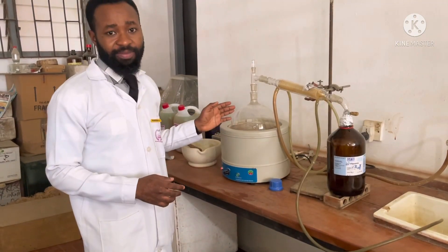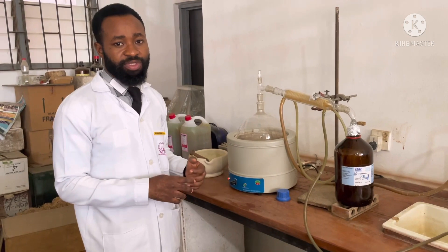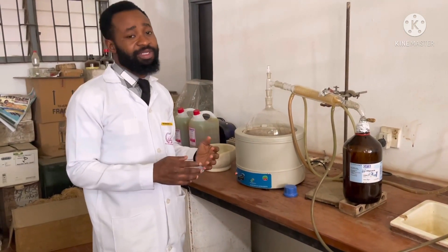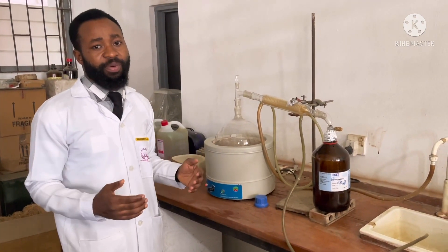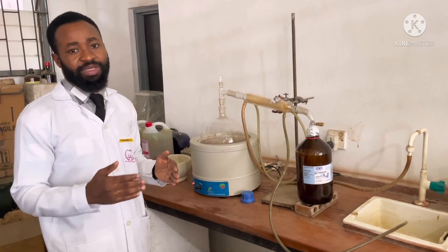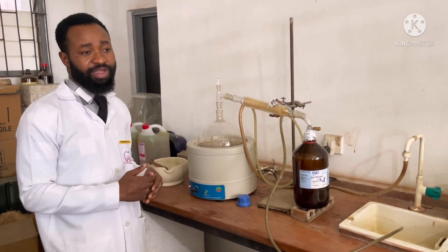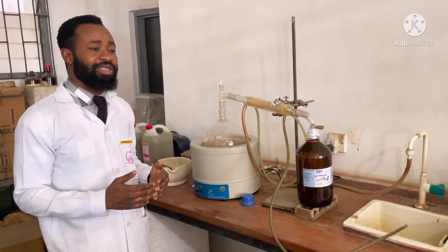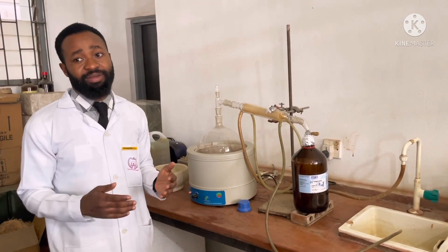At this stage I am distilling the petroleum spirit, which I'll be using for the partitioning of the roots. This is the process of distillation. I'm distilling because the majority of the compounds are imported to Nigeria in large drums, and thereby they have to include some stabilizers to stabilize the solvent because the solvents are very reactive with the drums. I also wanted to note that these stabilizers are very, very reactive to UV rays.